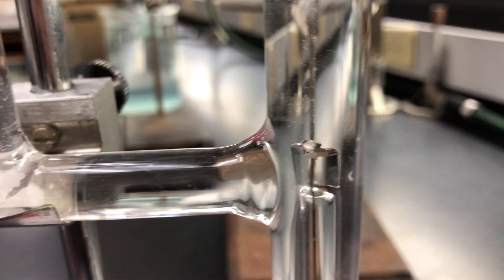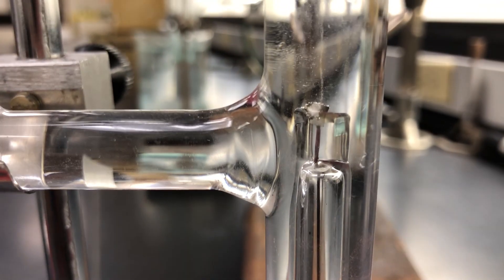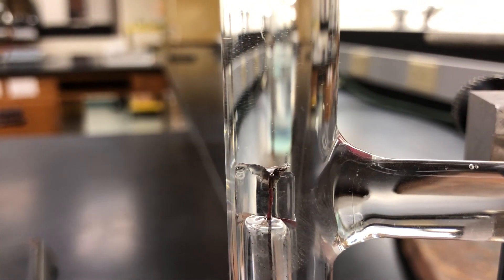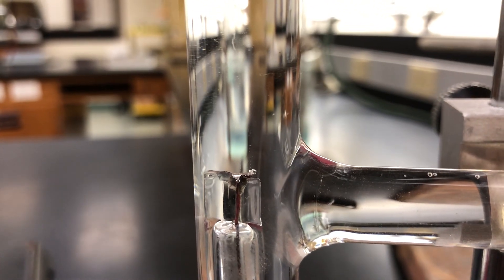and flowing across the tubes, and we're just starting to see some gas production right there. And on the other side, a tiny bit of gas production there as well.